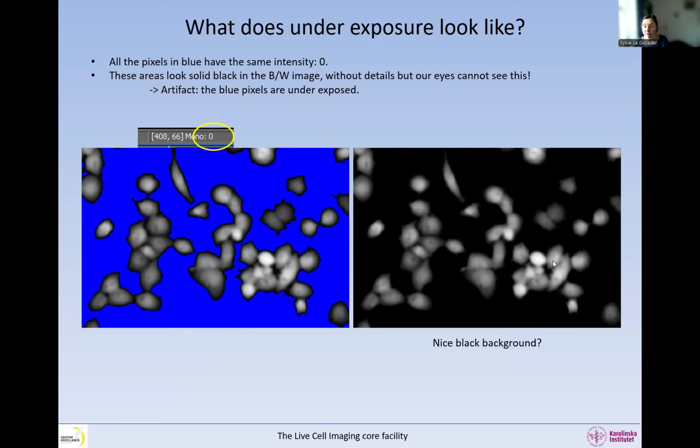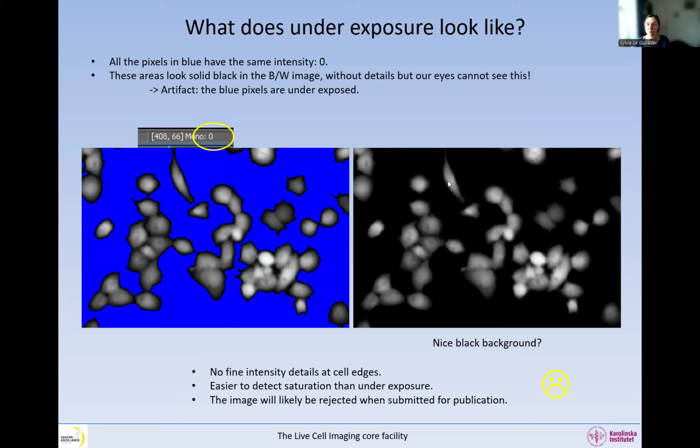And yes, it's a very nice background, but there are absolutely no details at the edges of the cells. And I will show you this later. It's much easier to detect saturation than underexposure. Unfortunately, if you send an image like this in an article and the journal does their job properly, this image is likely to be rejected.